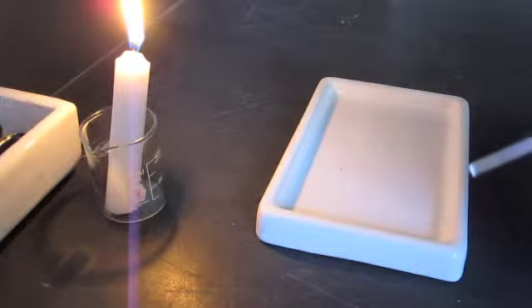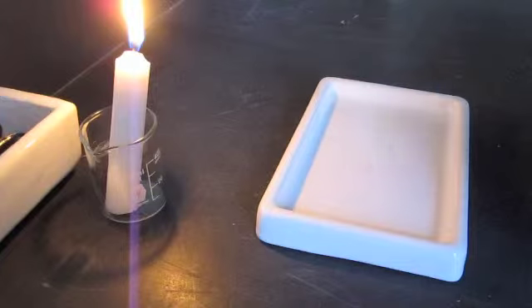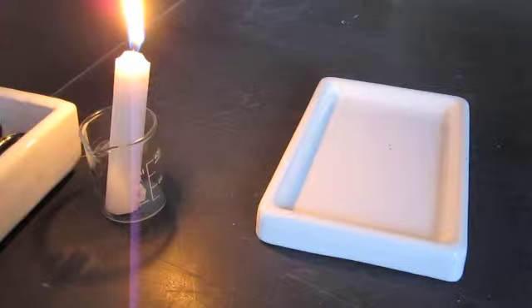So this is an example of a synthesis reaction. I'm just going to hold the magnesium ribbon over this flame.